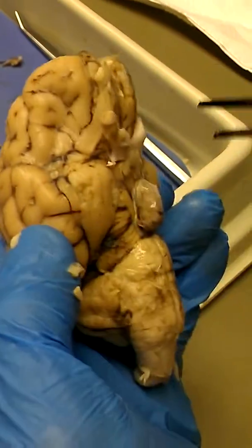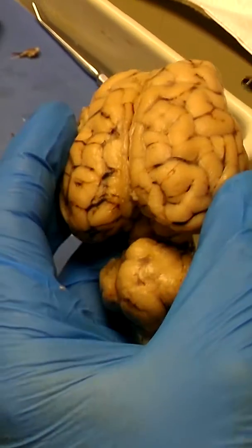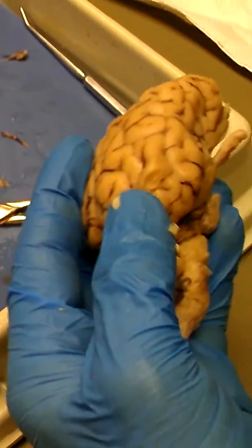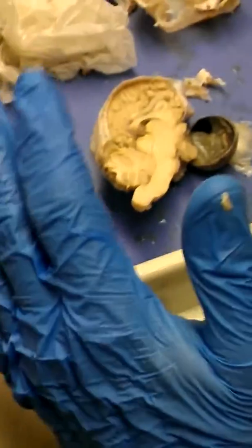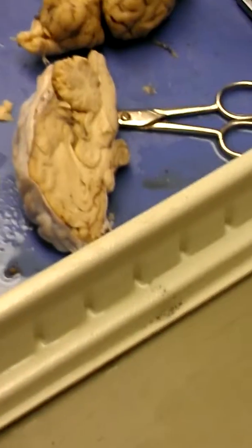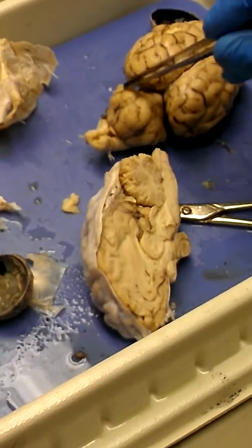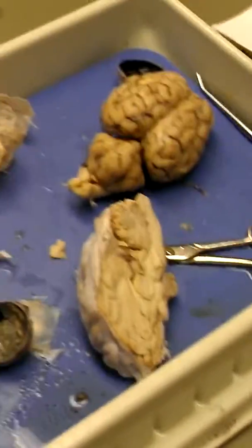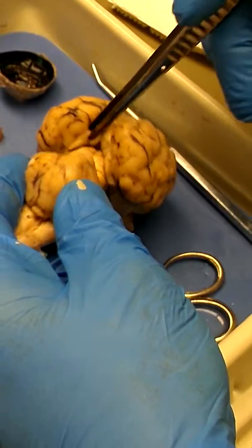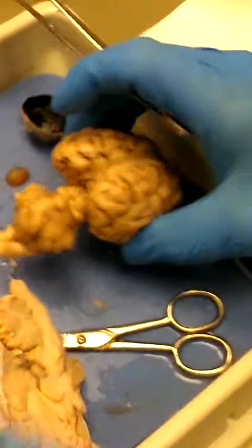Outside, frontal lobe, optic nerve, olfactory nerve, frontal lobe, parietal lobe, occipital lobe, temporal lobe. What about the sulcus? Oh, this is a gyrus. That is a sulcus. Right. This is a fissure. This is a fissure here. Okay. And I can remember, I could go like this and pin it like this. I could pull this guy forward and pin those guys that way too. Superior and inferior colliculus. Okay?